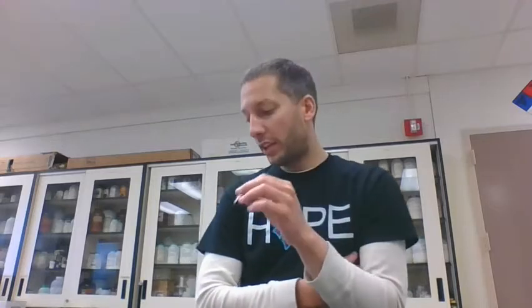So that equation that you have on your sheet is 2 Mg plus O2 produces just one product, 2 MgO. Okay. So we got this strip of magnesium here. We're going to light it in the burner. It's going to react with the oxygen in the air, and then we'll be able to measure how much magnesium oxide we get from this. So we're looking at this like the same thing we did. We just finished that nail lab.